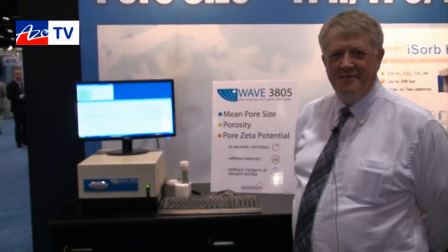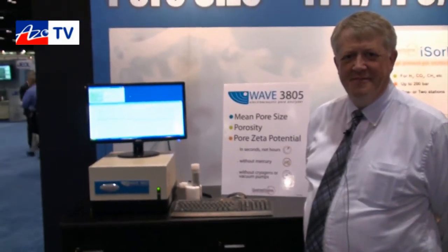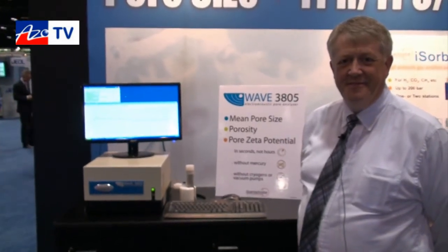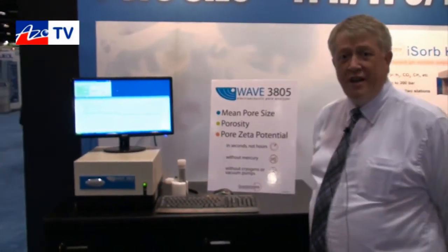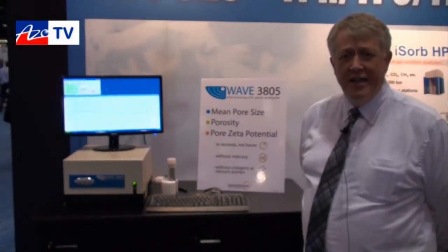This is Cameron Chai from azom.com bringing another episode of AzoTV. Today we're speaking to Martin Thomas from Quantachrome, who's going to tell us about their new 3805 and 1905 porosity analyzers. Thank you Cameron. I'd like to show you the new Wave Series of analyzers that we're introducing at PitCon this year.